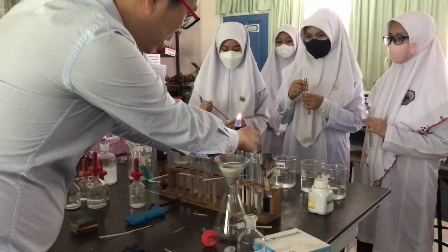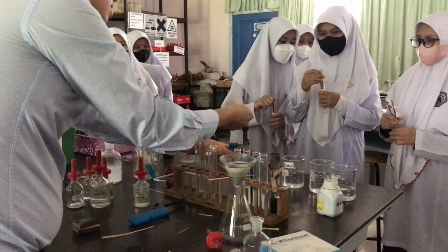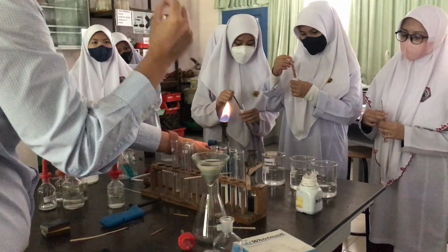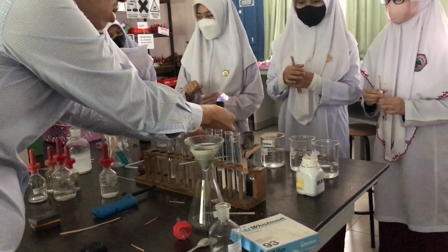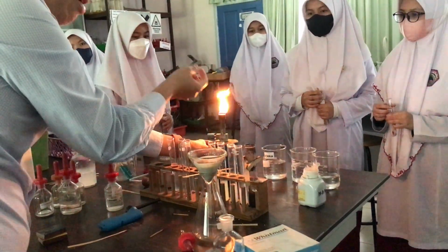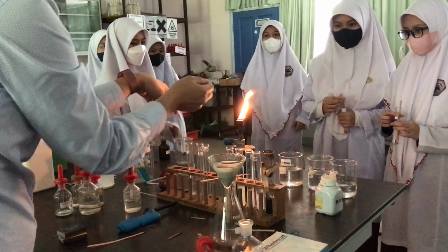Okay, what I'm trying to do is, can we do a flame test using this flame? No. Because here you can see the orange color, right? What if your stuff is orange color? Then you cannot see. This one is like not enough oxygen. That's why if I put paper on top, you will get black stuff because there is not enough oxygen.